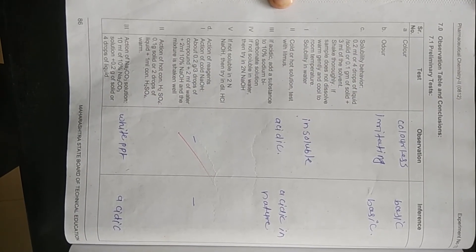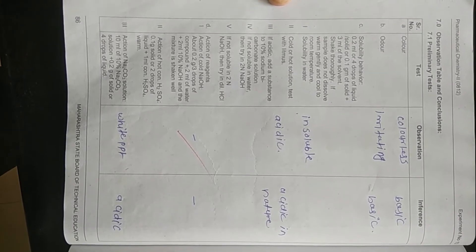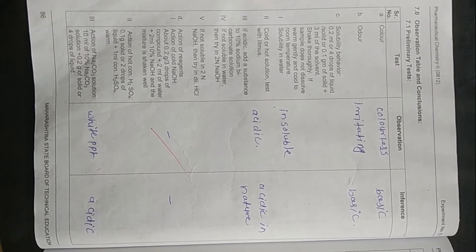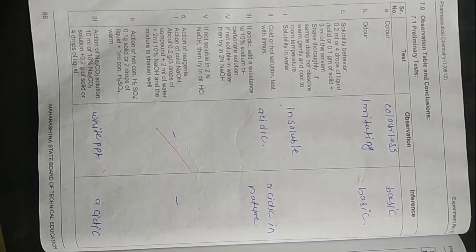In the preliminary test of experiment number 13, the unknown compound is a liquid compound. It is colorless, has a basic nature, and has an irritating odor. We also observe its solubility behavior.